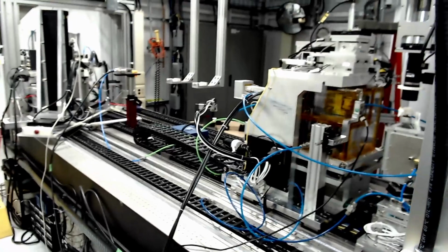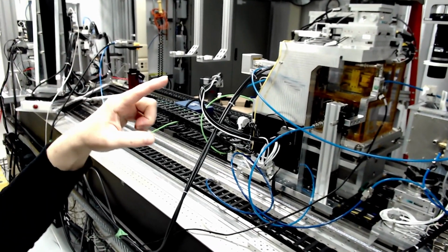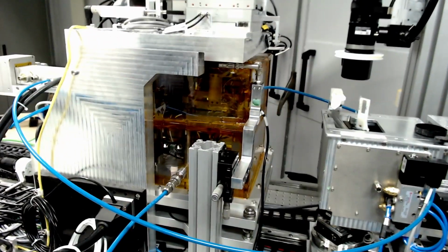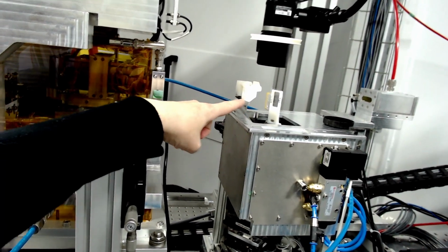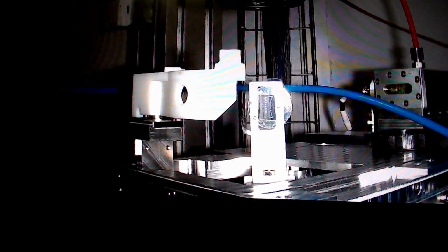So this is our hatch, and this is where we do our experiments. The beam is actually coming from there upstream, comes over here. We actually make the beam very, very small. It's as small as the cross-section of our hair. This is our sample. The sample is actually composed of multiple heads of zebrafish, and I will show you in a moment how they look. This is actually an image from the camera looking directly at the sample that I was showing you.